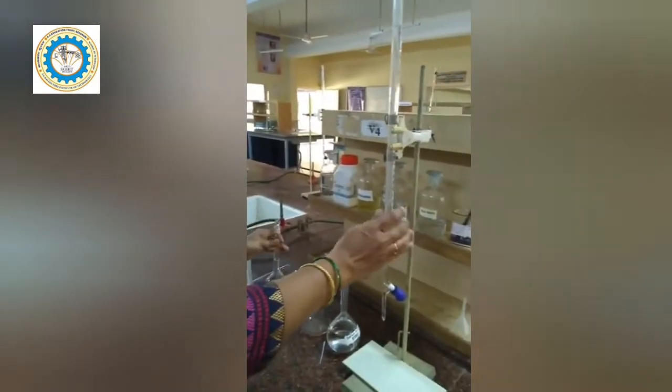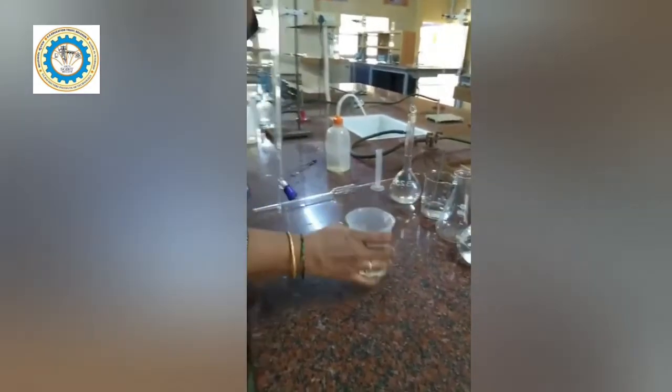This solution we are going to take it in a burette which is present on a stand. Now I am going to fill the sodium salt of EDTA into this burette. Take a small quantity of solution in a beaker, then transfer this solution using a funnel. Hold it in this way, then add the solution to the burette. Set it to zero.